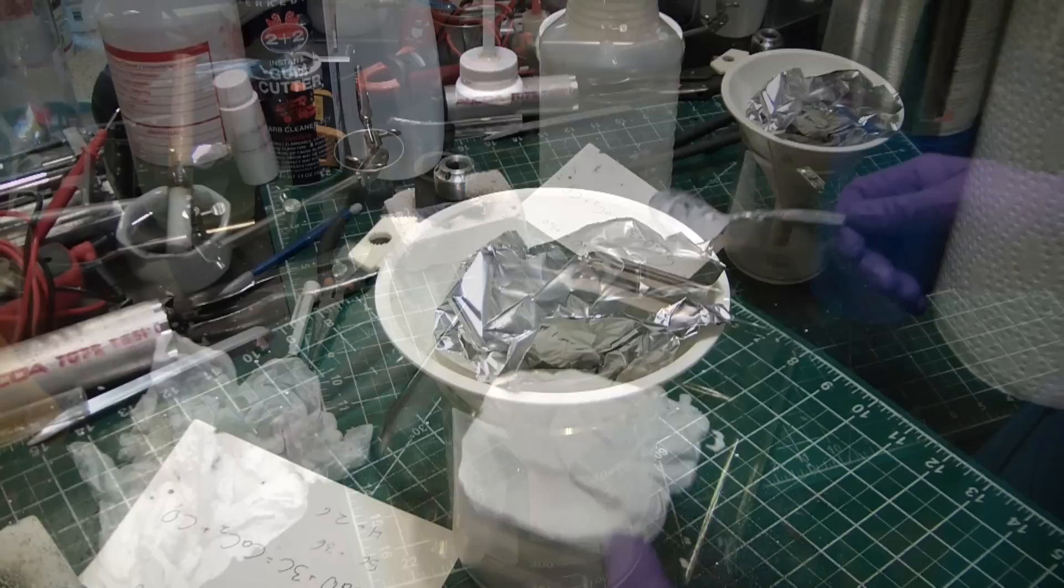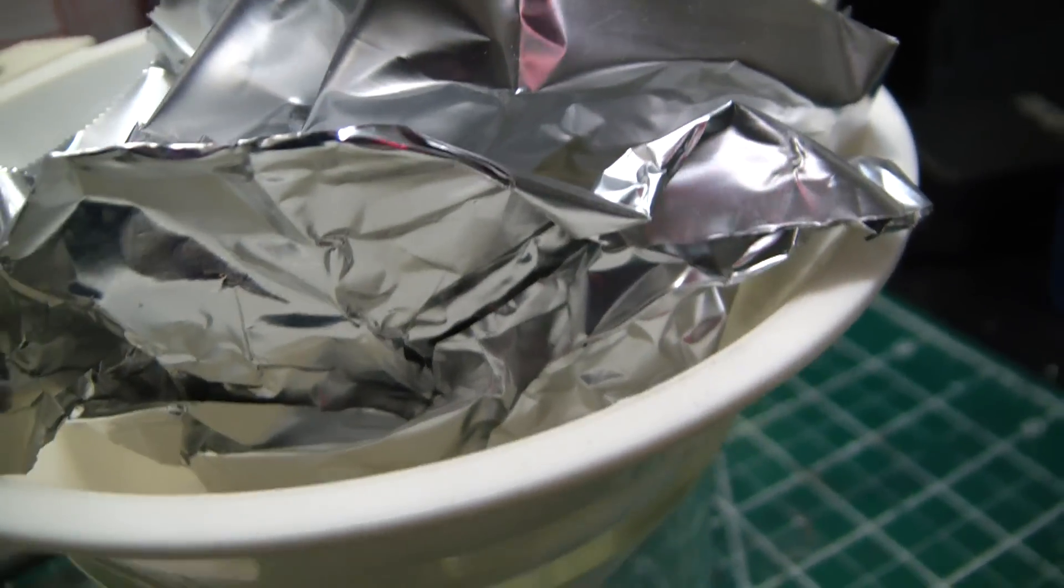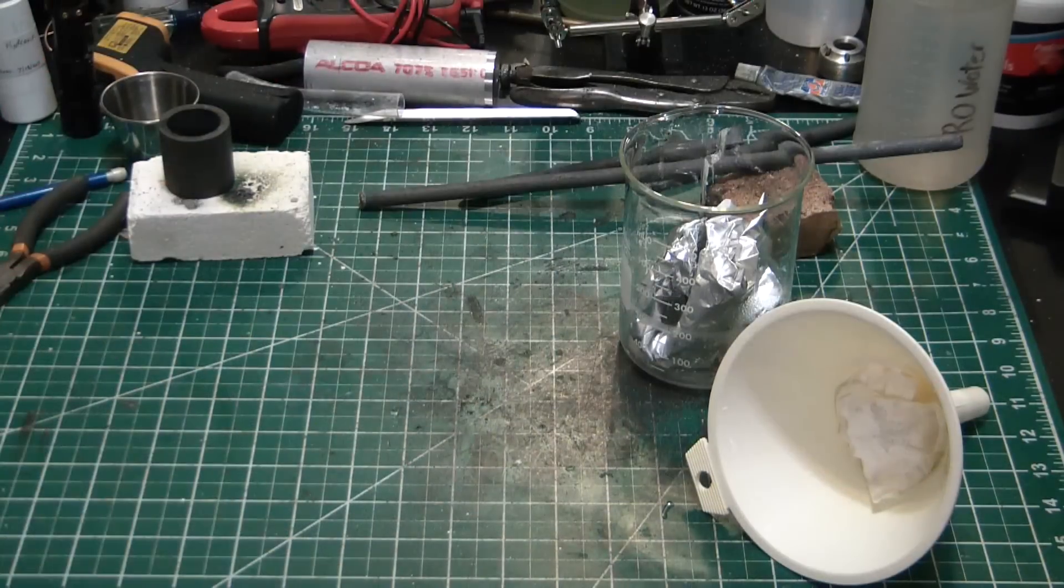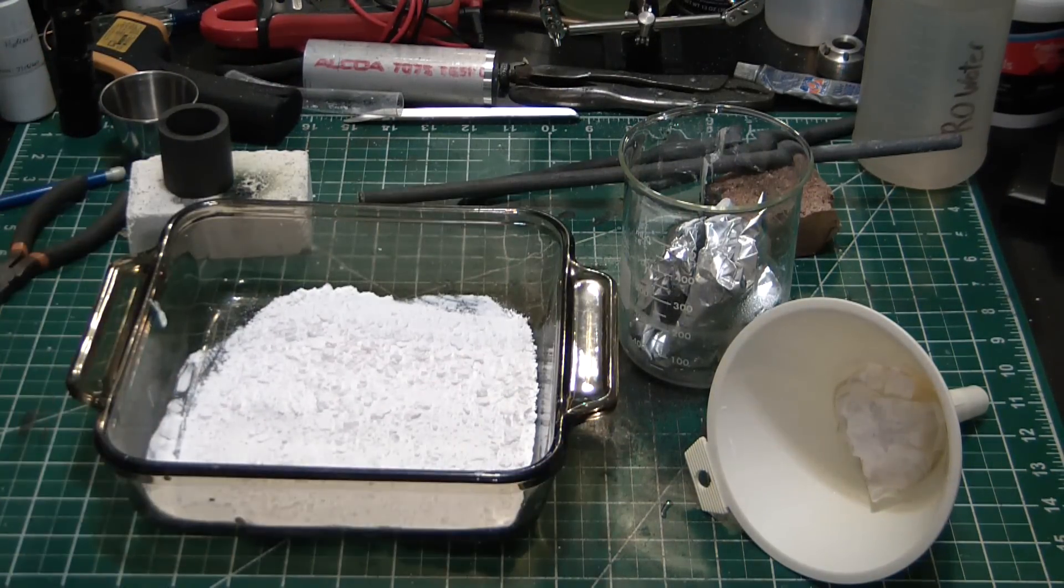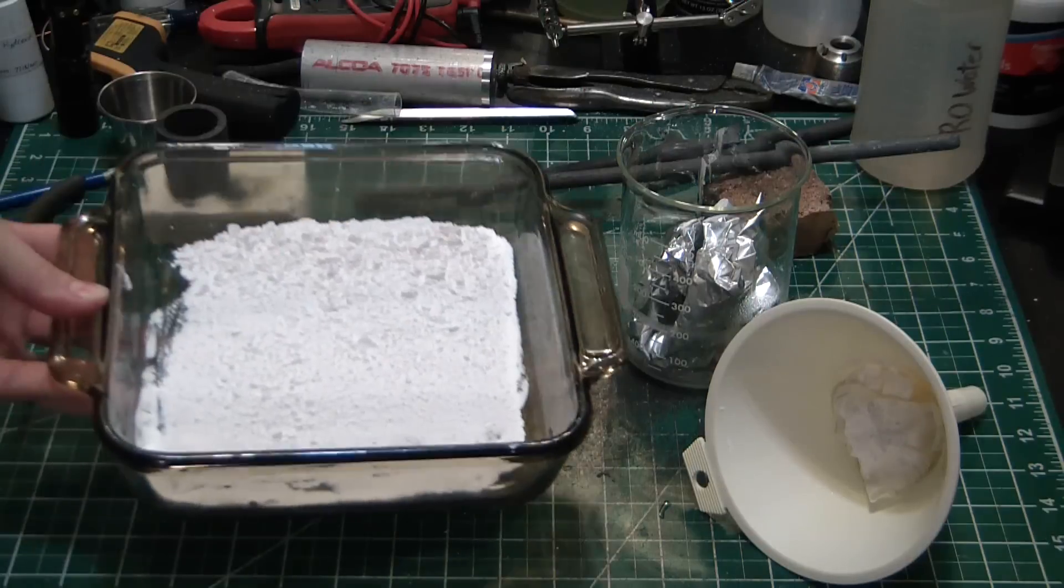Throw it in the oven. Good thing I didn't follow through with that brain fart. Took a while, but it's definitely reacting. All right guys, here we go, fresh out of the oven. As Gordon Ramsay would say, you cooked the fuck out of it.